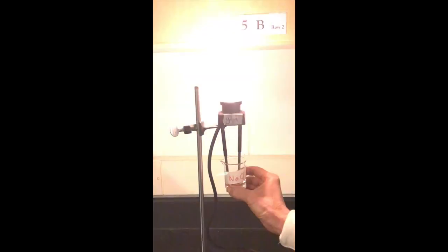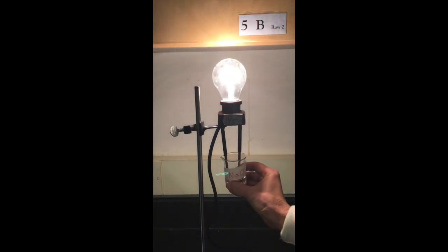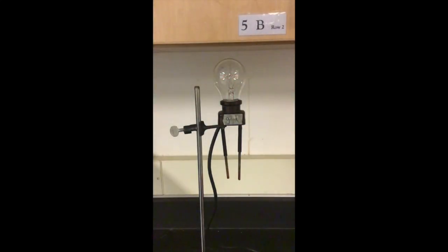The next solution is sodium chloride. Here we can see we have a very bright light, which tells us we have plenty of ions in our solution. We're going to clean our probes.